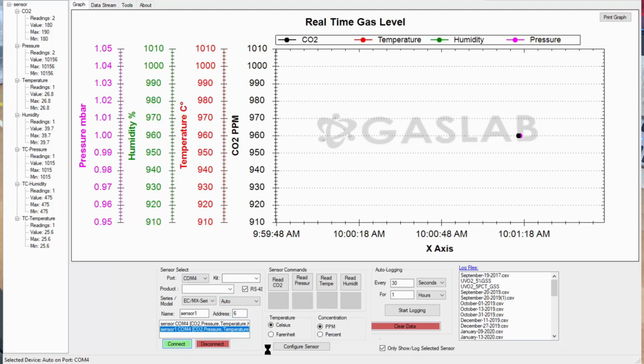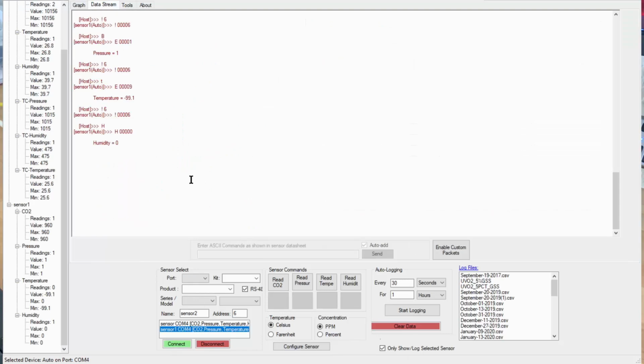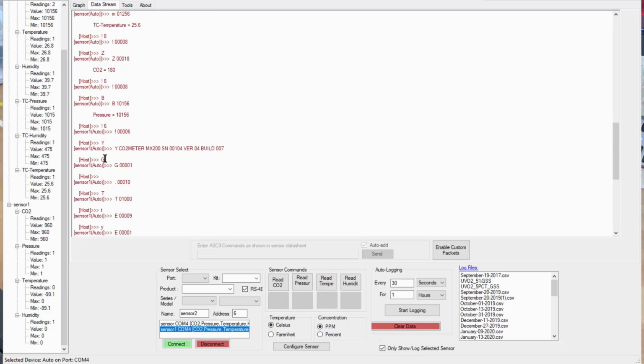And you'll see we got a CO2 sensor here. You can actually see what was communicated to the device. It identified itself. It looked at address 6 down here. It asked for address 6, it got an acknowledge of address 6, and it verified what it was and got its information that it was gas type 1 and all those good things.